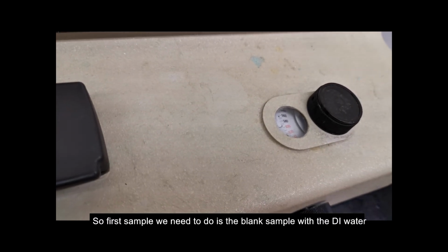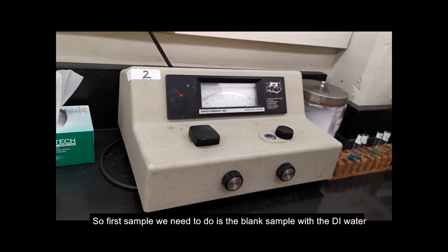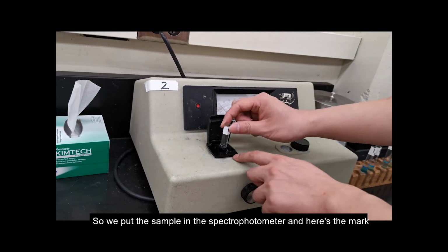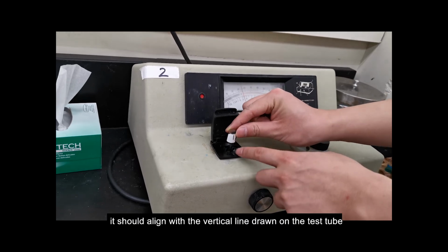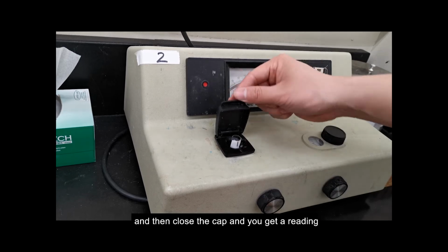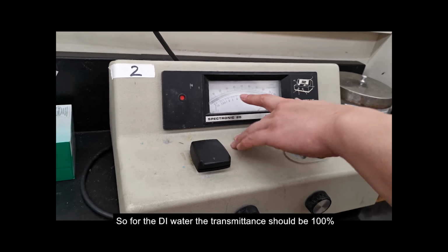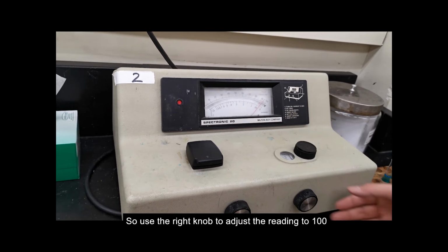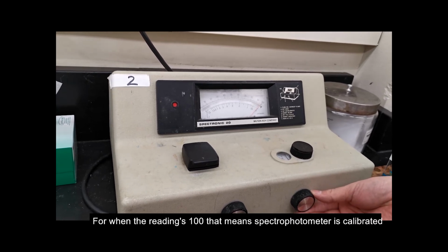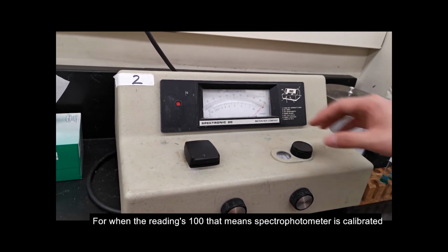Okay. So first sample we need to do is the blank sample with the DI water. So we put the sample in the spectrophotometer. Note that here is a mark. This should align with the vertical line you draw on the test tube. Okay. And then you close the cap and you get the reading. For the DI water, the transmittance should be 100%. So we use the right knob to adjust the reading to 100. Once the reading is 100, that means the spectrophotometer is calibrated.